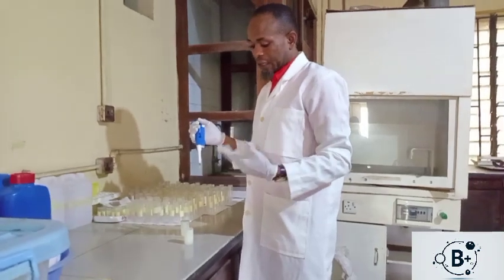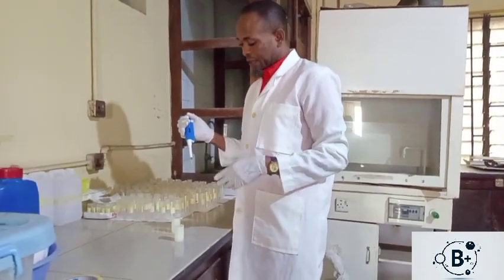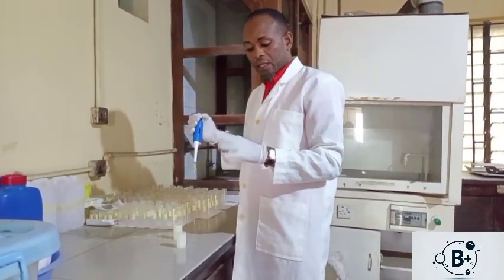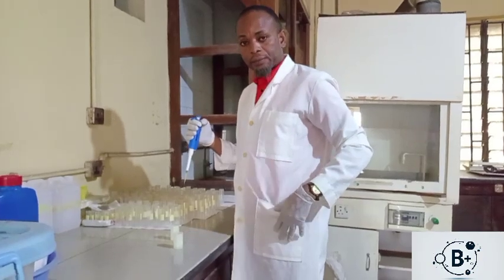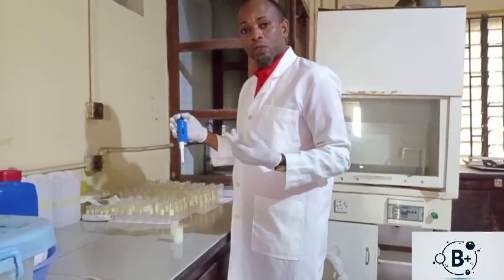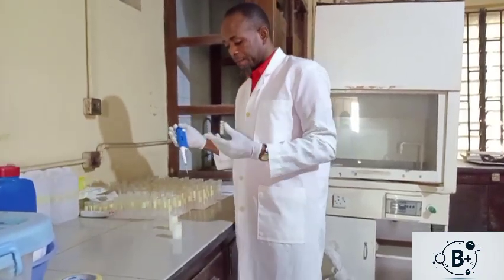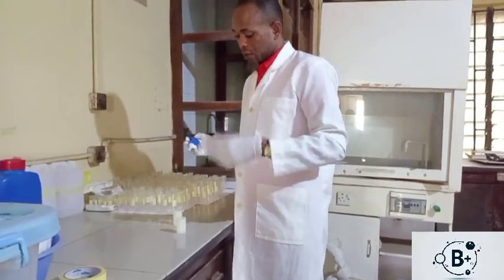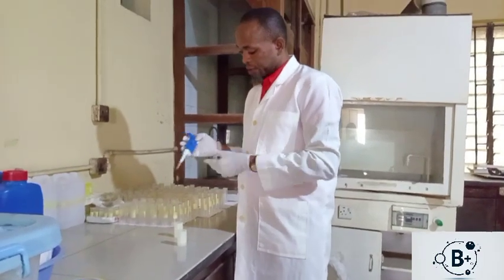Then use it. In some cases there are some of those chemicals that may have effervescence. So that means your personal protective equipment will include not just the lab coat and gloves. It will also include your nose mask in case you have a chemical that is poisonous or that has much effervescence. So that is how the micropipette is used.